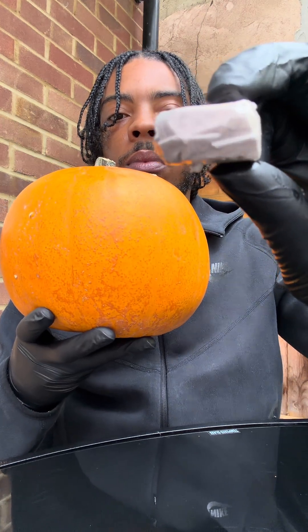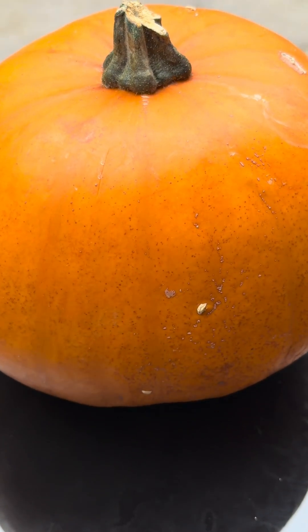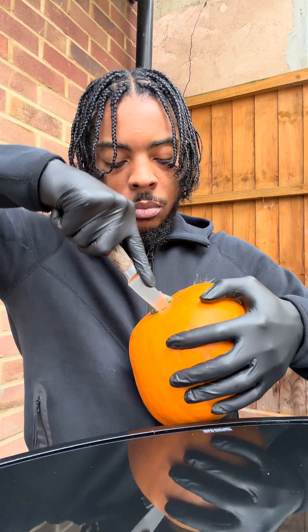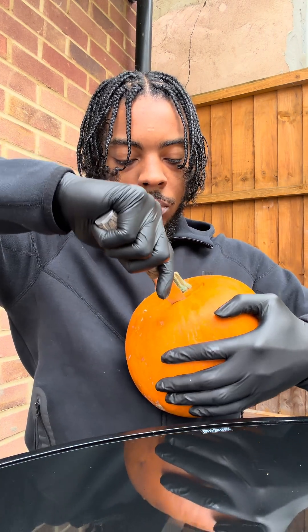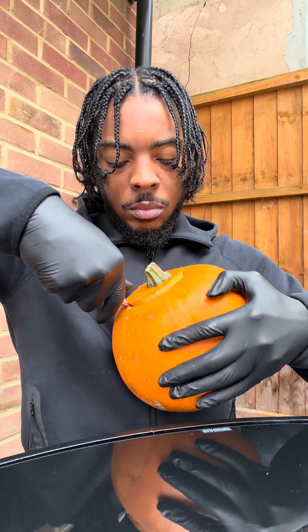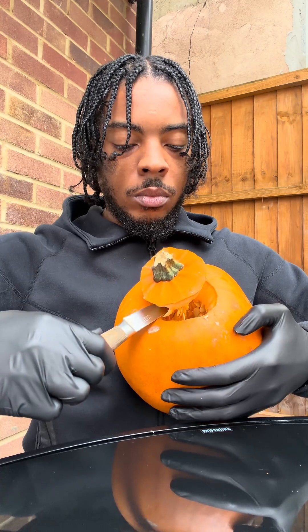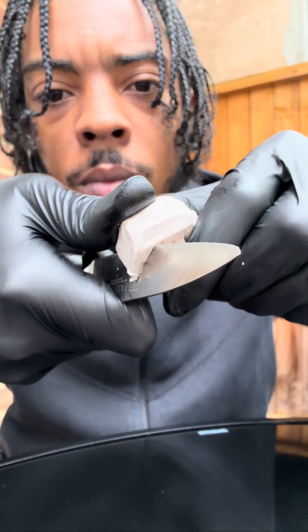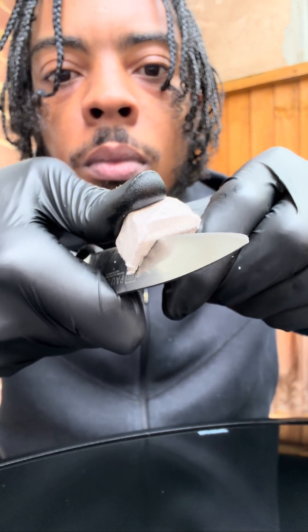We've got one pumpkin and some sodium metal, and we're going to slap the sodium metal into the pumpkin and see what happens. Now, pumpkin seeds contain vanillic acid, and the skin — if you ferment it — produces vanillin, which is the main component of vanilla. You know, ice cream settings.